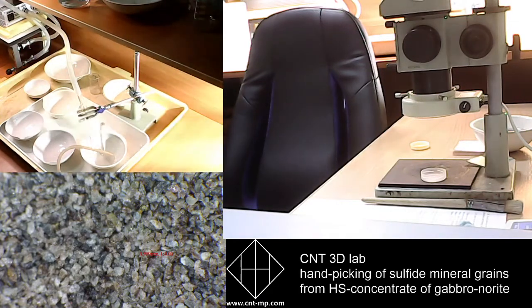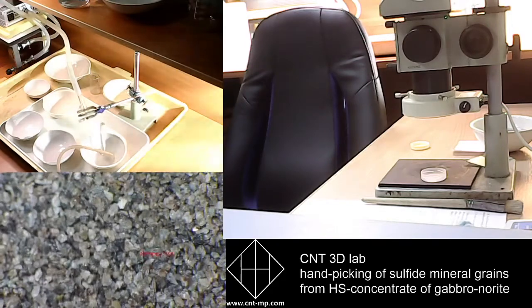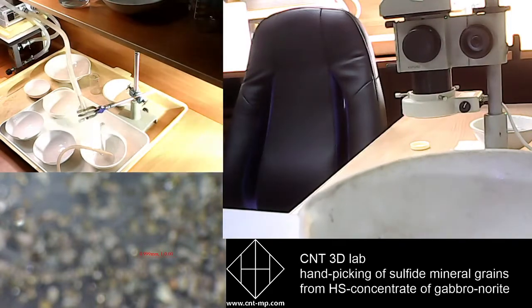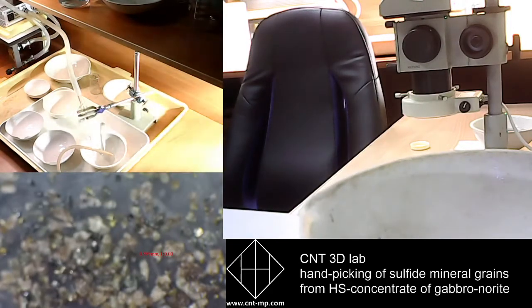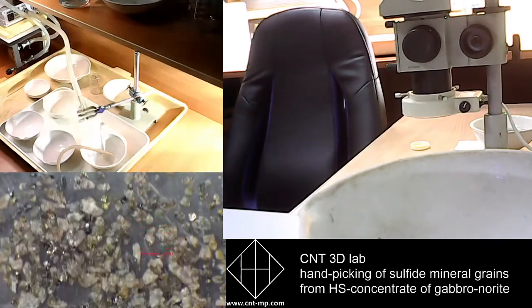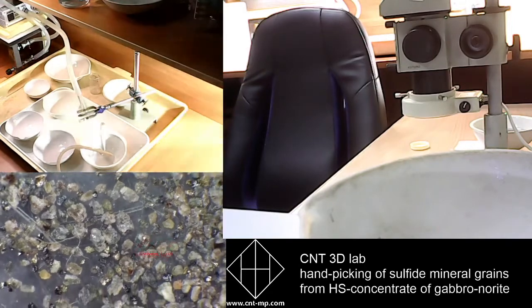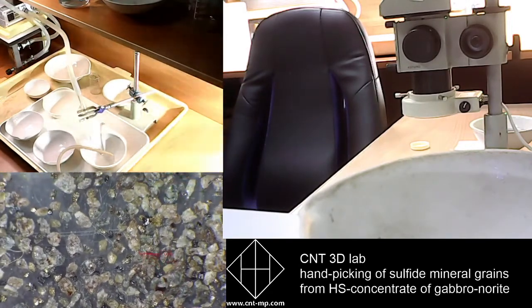And after that we look at every hydro separation product carefully for gold mineral grains. Sometimes it could be gold grains, sometimes sulfides, or zircon, or any other base metal minerals like magnetite, chromite, and etc.